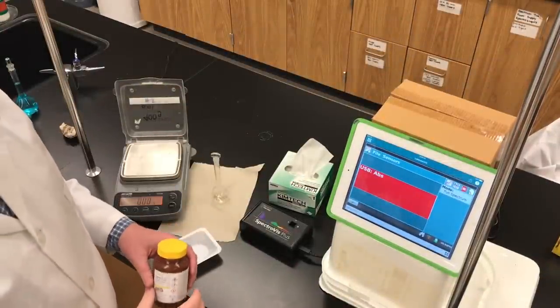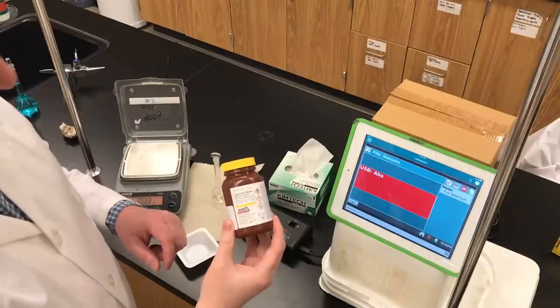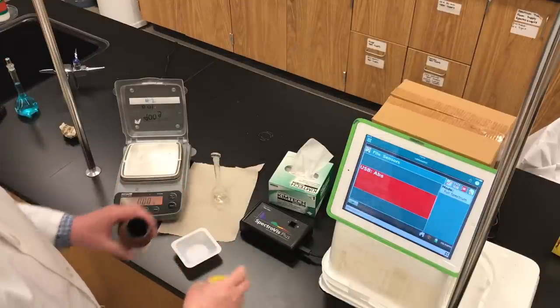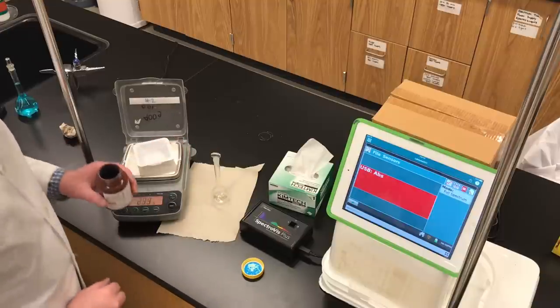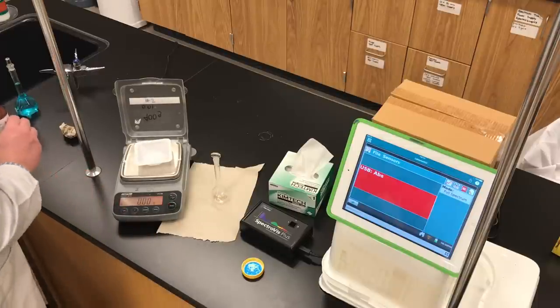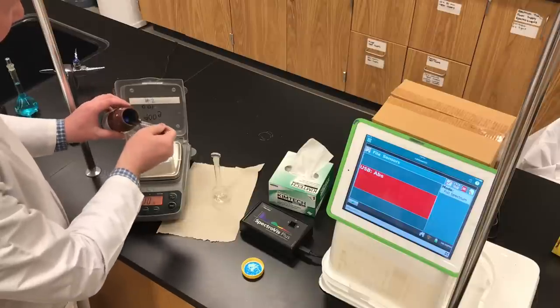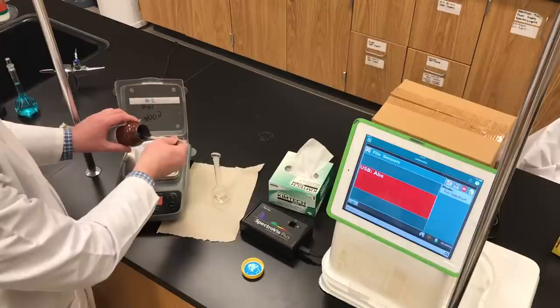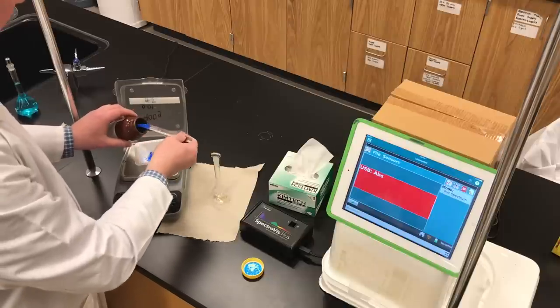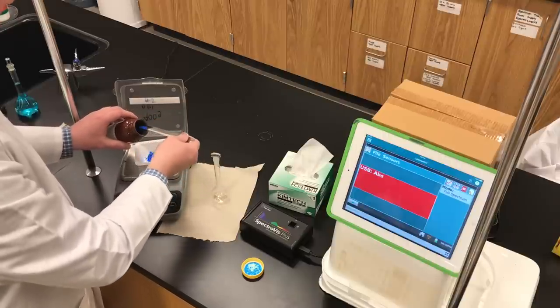Next, we're going to prepare a stock solution — a standard solution of copper-2-nitrate trihydrate. Copper-2-nitrate trihydrate is our solute; it's a blue-colored salt. I'm going to weigh some out into a weighing boat on an electronic balance. We'll zero the balance to make sure the mass of the weighing boat is not included. When you are weighing, hold the bottle above the balance so if you spill, it spills into the weighing boat.